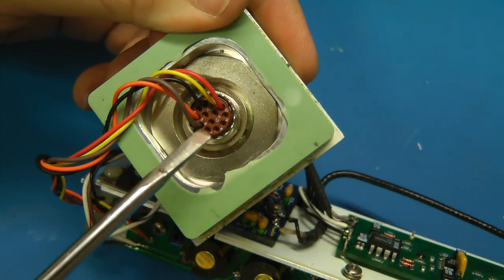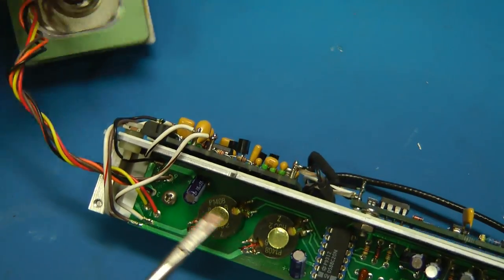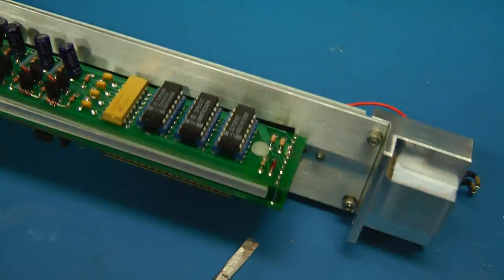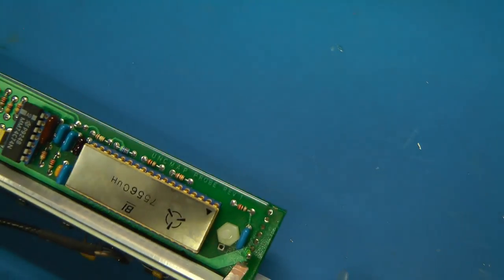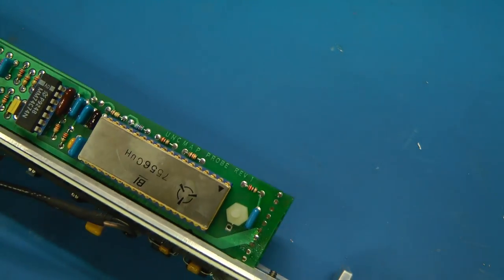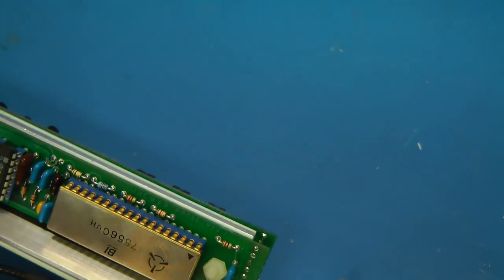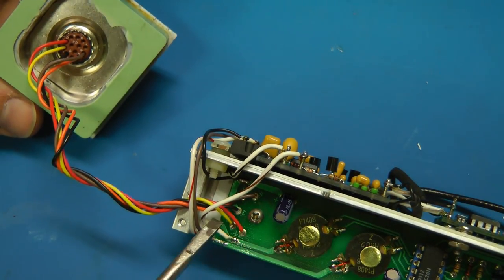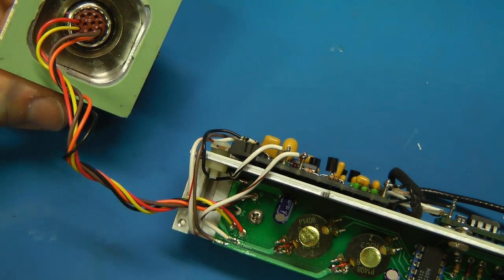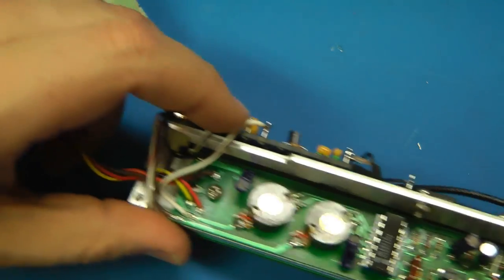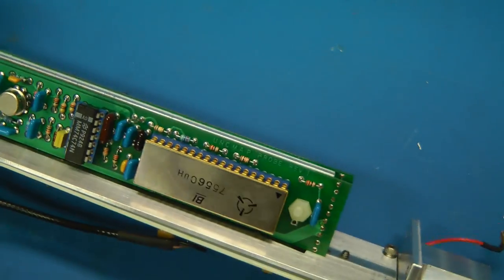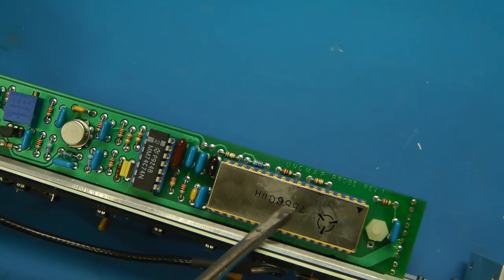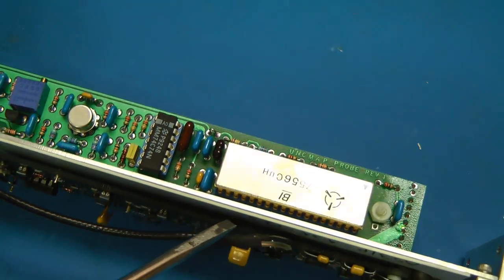And over here. Yeah, this has a bunch of connections that are soldered through onto the other side of this. So given they're doing data communications, it's possible they're sending analog information over these lines encoded into some sort of like AM or FM or something. So that is a possibility. All that magic is probably done in this chip here. I'm gonna go see if I can find any information on what this is. Although I don't have much hope on that.